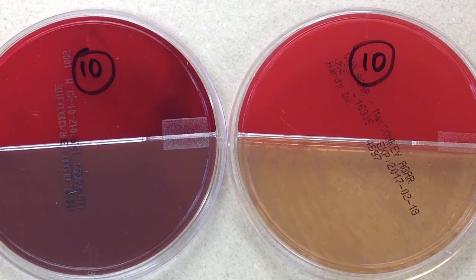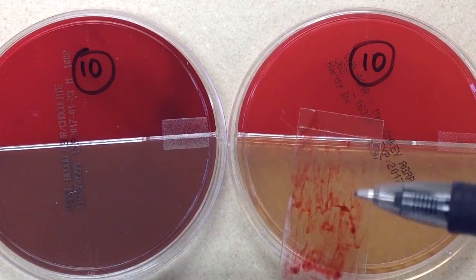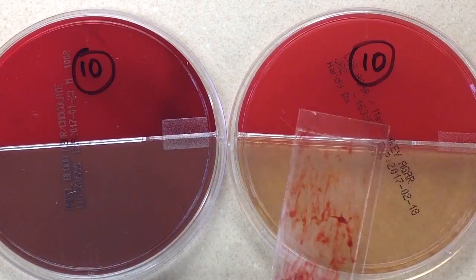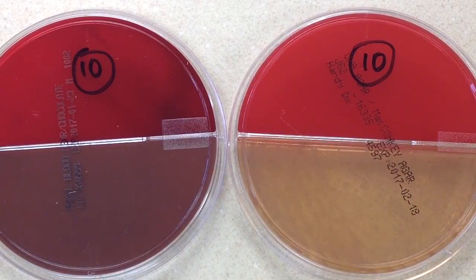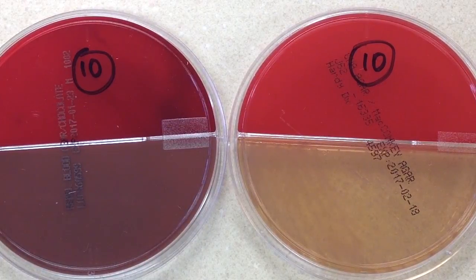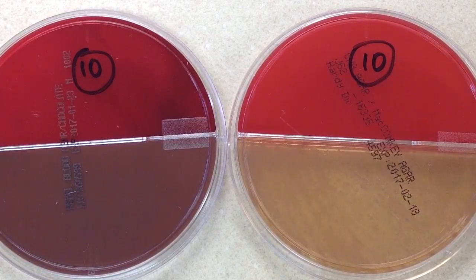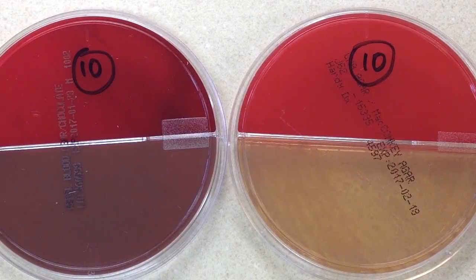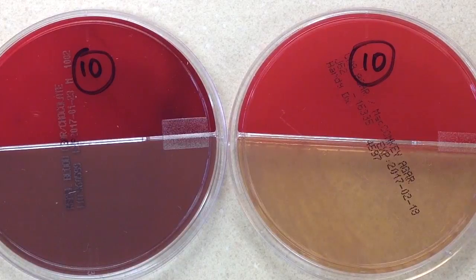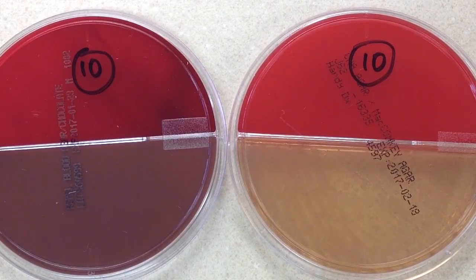Basically, the sputum or material that was aspirated is put on the slide, allowed to dry, the gram stain is made, and then it's read. The purpose is, first, to see if it's an acceptable specimen, because oftentimes sputum specimens are collected by having the patient spit into a cup, and what we often get is just saliva.